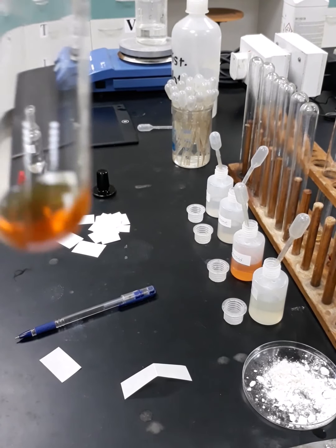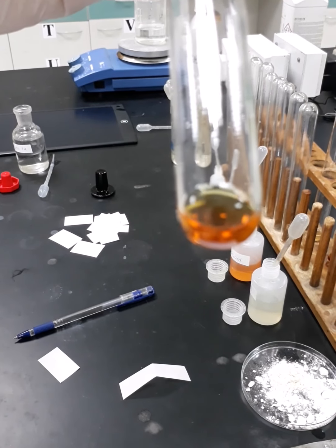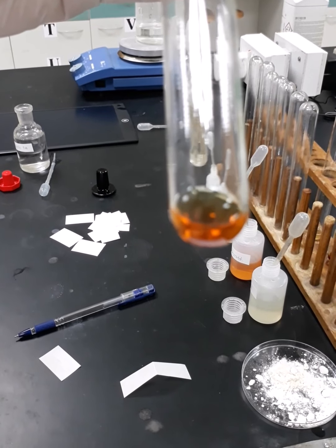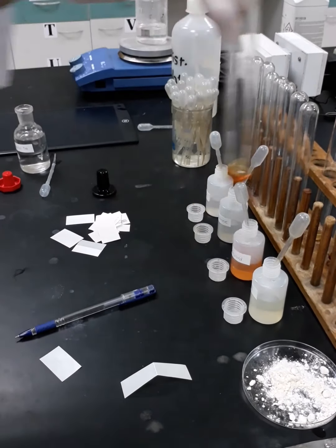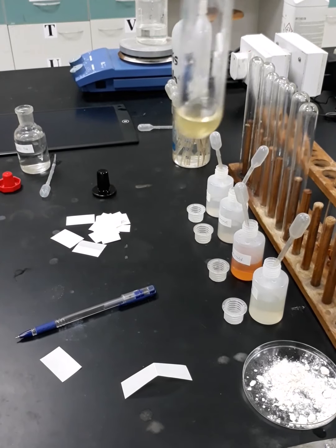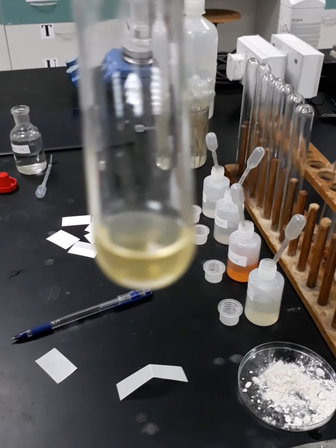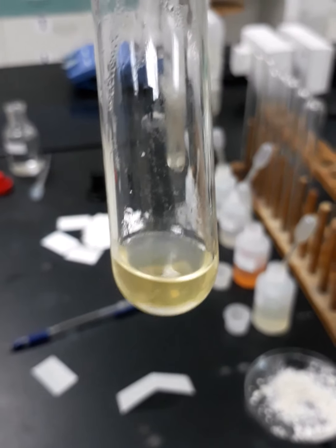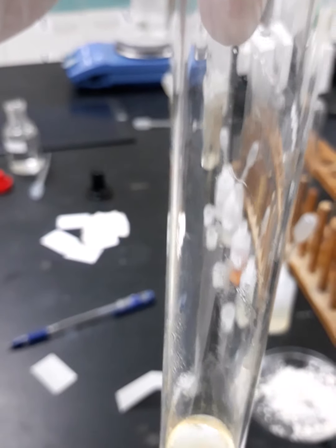When we go to the para-aminobenzoic acid, we will not find any yellowish body or yellowish precipitate at the bottom of the test tube, because for sure this is our control and it shouldn't react with the iodoform test. Okay, last is acetone. Once again, we can see here the yellowish bodies, and I'm going to show it to you by addition of more drops of iodine.